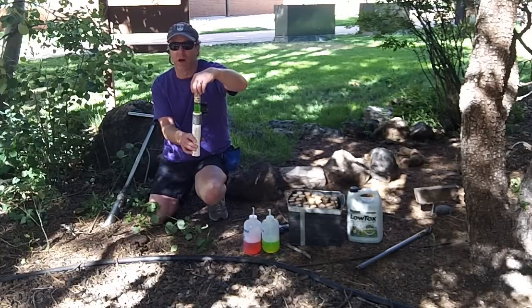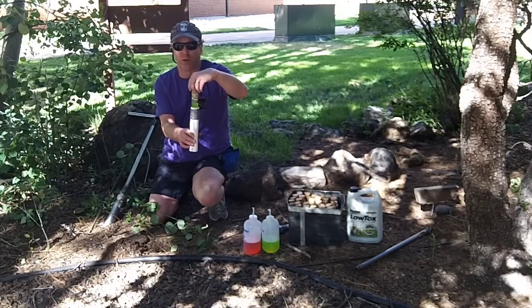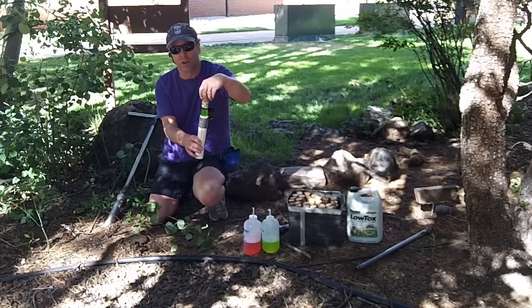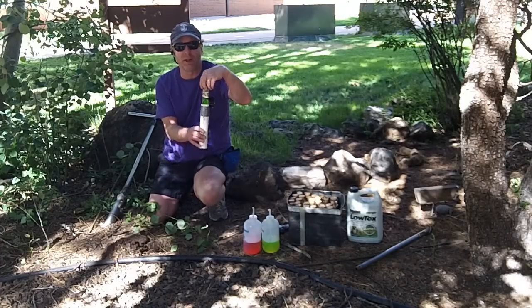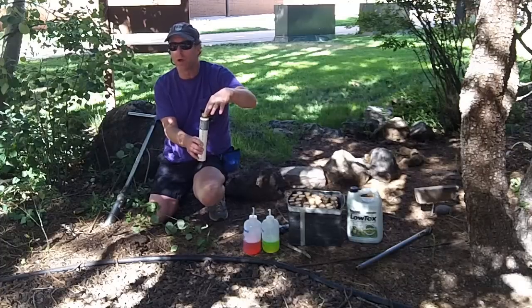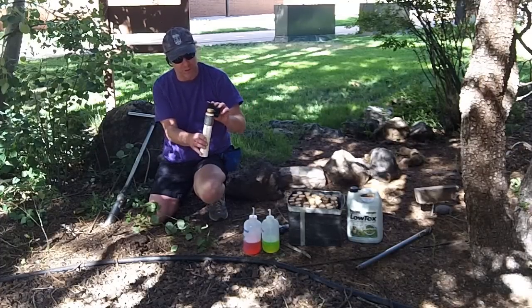You can use ethylene glycol, but it is poisonous. These traps are really designed to prevent things from drinking it. Ethylene glycol also denatures DNA, so we like to go with propylene glycol even though it's more expensive. We have a cork that we use to cap the pitfall tubes.